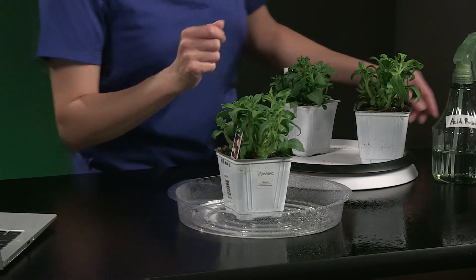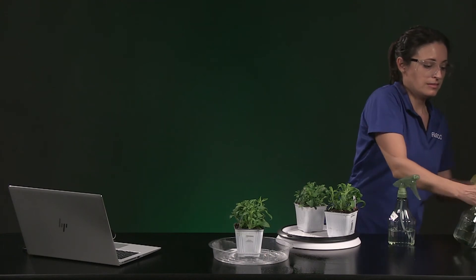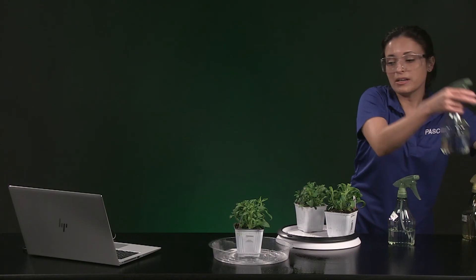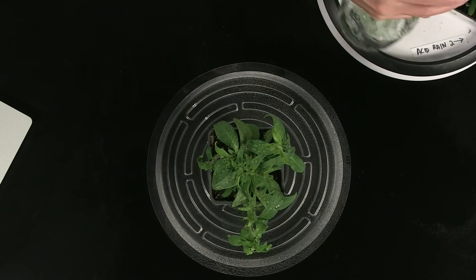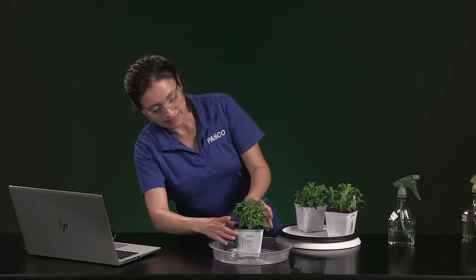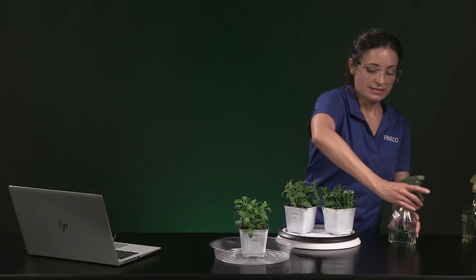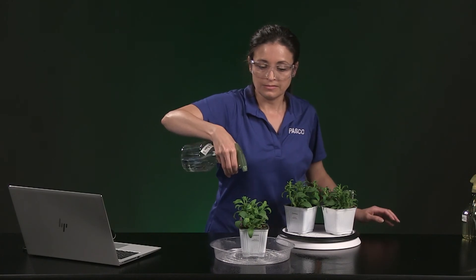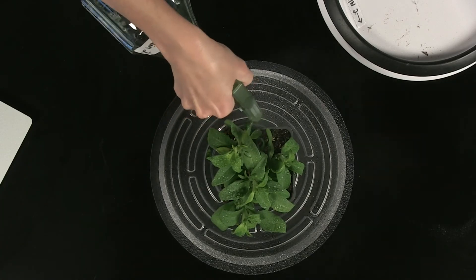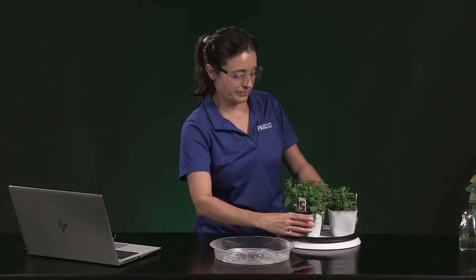Acid rain 1 is next. I'm priming the bottle: 1, 2, 3, 4, 5, 6, 7, 8, 9, 10. And finally acid rain 2. Let's check back at 24 hours.